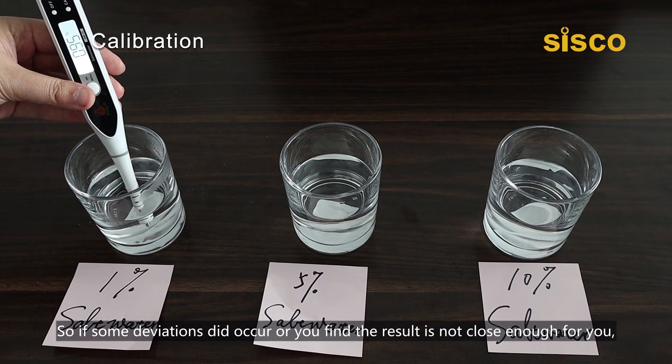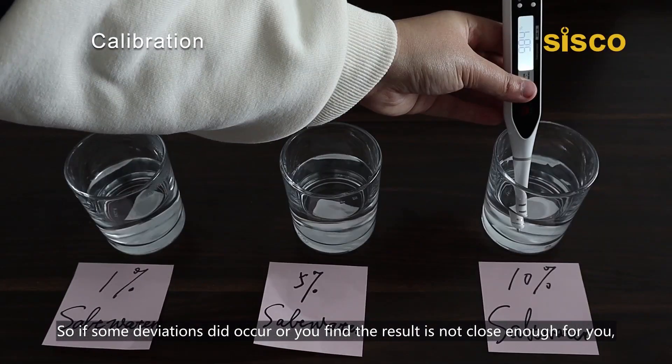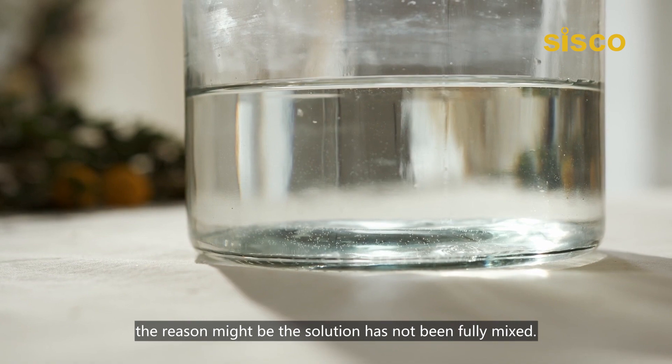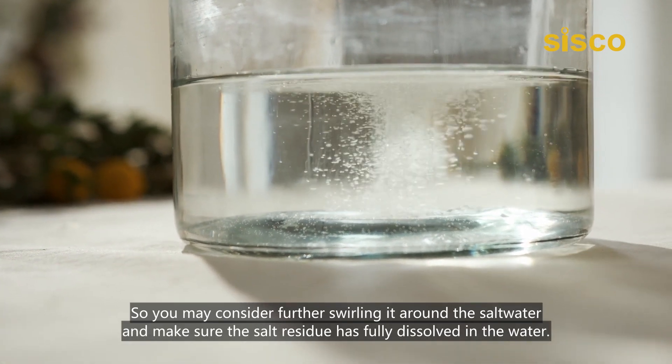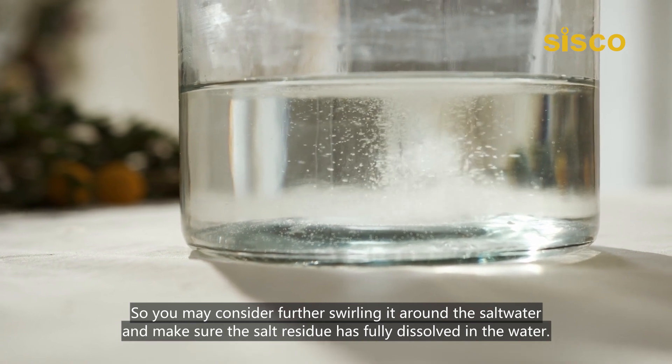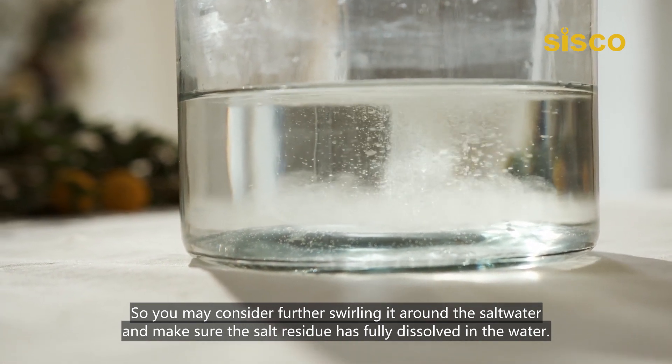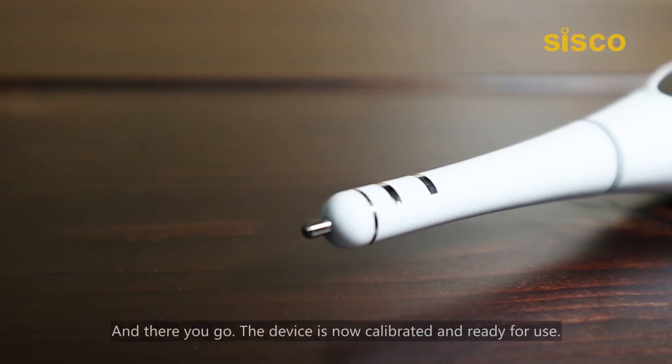So, if some deviations did occur, or you find the result is not close enough for you, the reason might be the solution has not been fully mixed. So, you may consider further swirling it around the salt water and make sure the salt residue has fully dissolved in the water. And there you go.